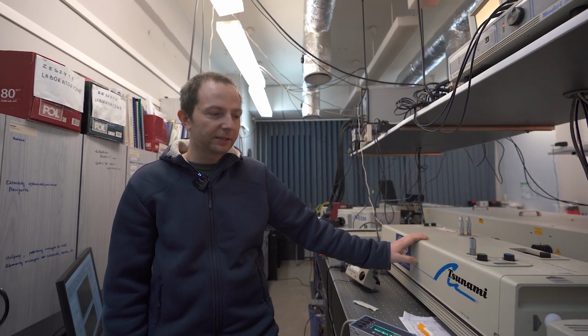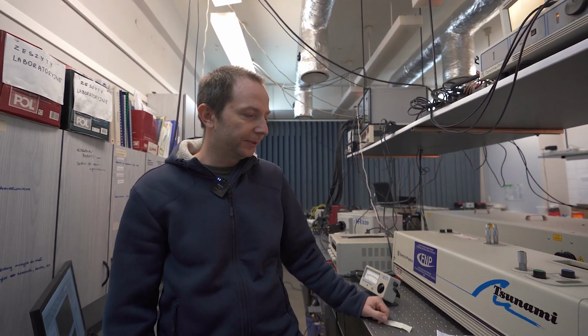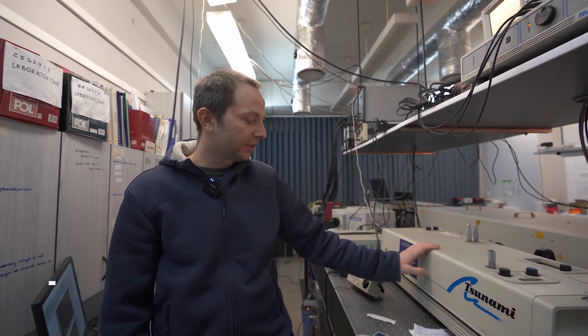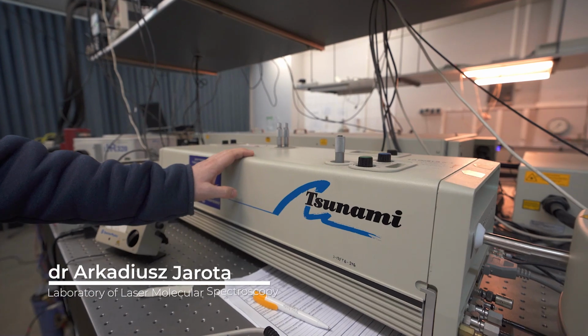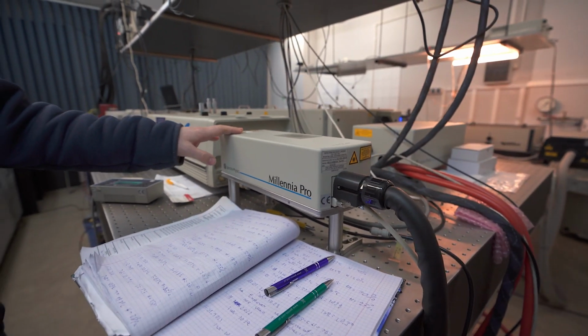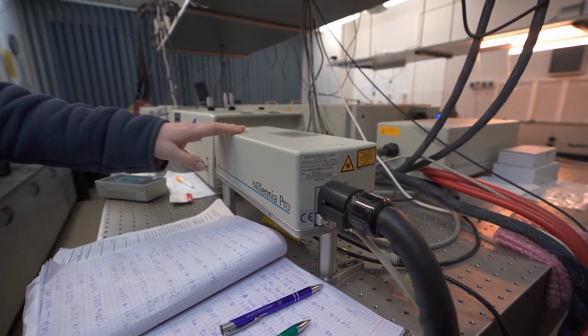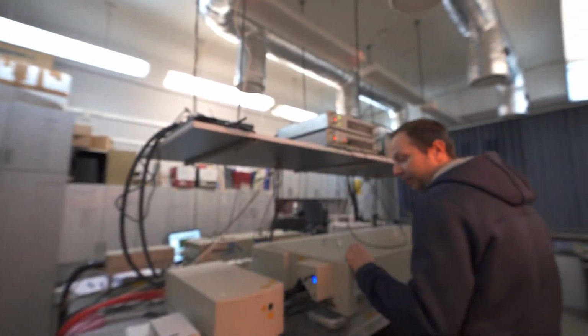We are in femtosecond laser lab. We have a transient absorption spectrometer here. The heart of this system is this femtosecond laser. This laser is pumped by second harmonic of this diode pumped laser. For the experiment, femtosecond pulses must be amplified in the amplifier.